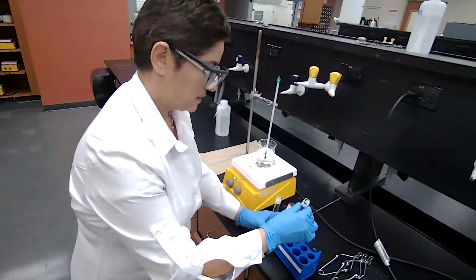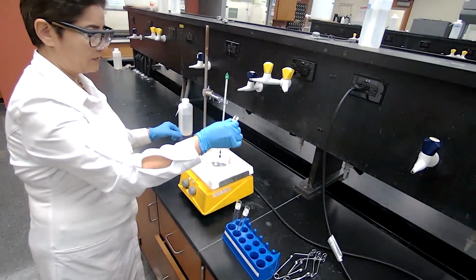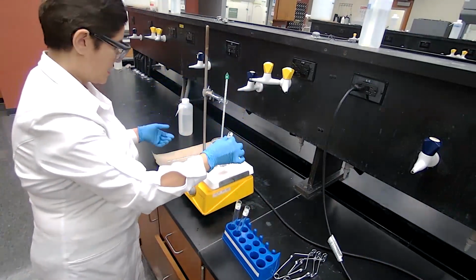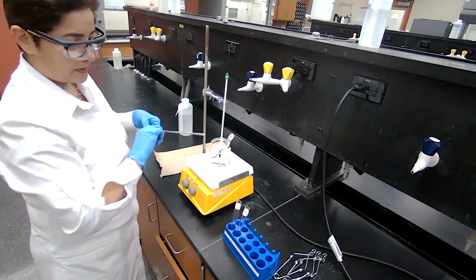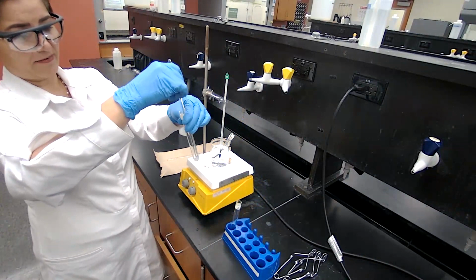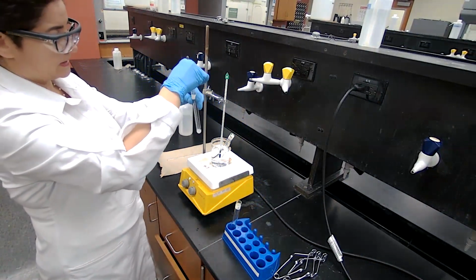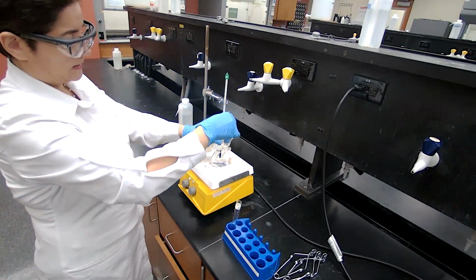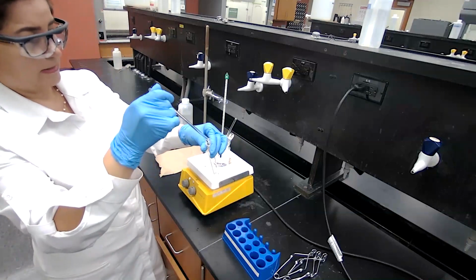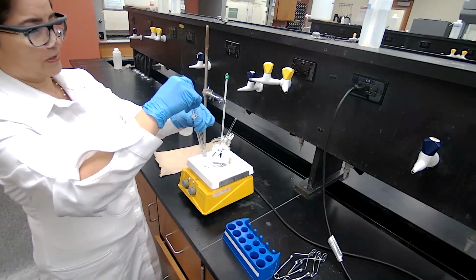for 20 minutes. For the test tubes that have liquid, just stirring or agitating is going to be sufficient, of course, to mix well. But for test tubes A and B, when we have a solid compound, we want to use the stirring rod to mix it well. And occasionally, we are going to continue stirring it, so we make sure the reaction is going.